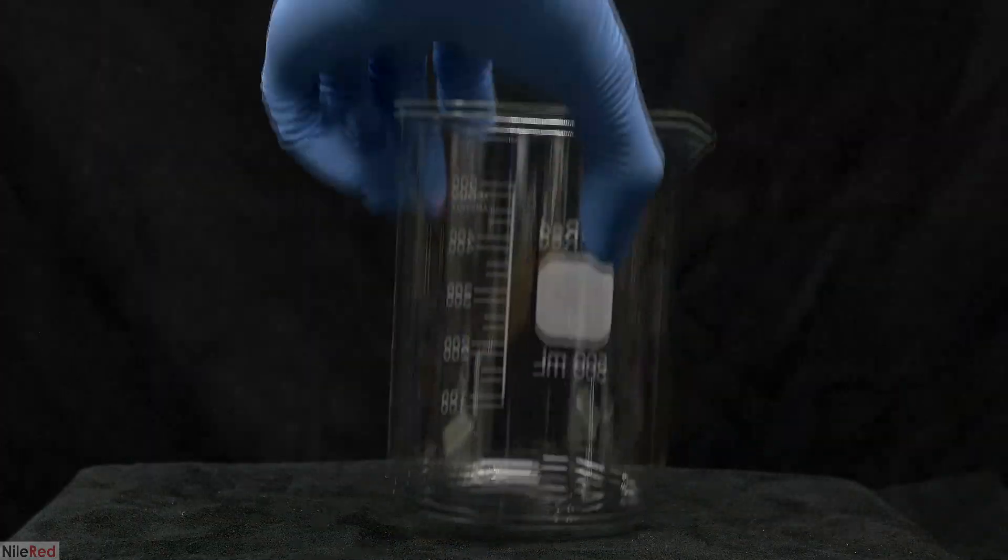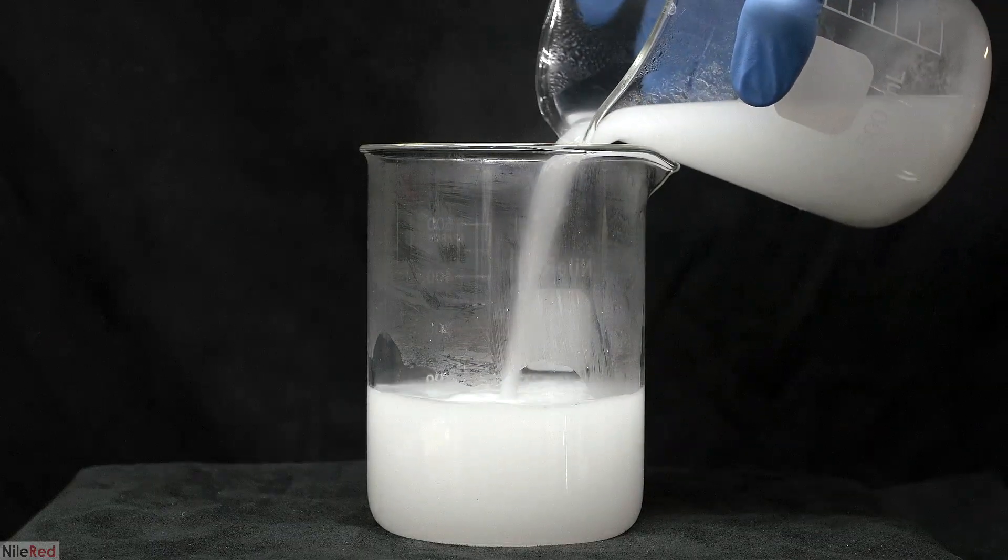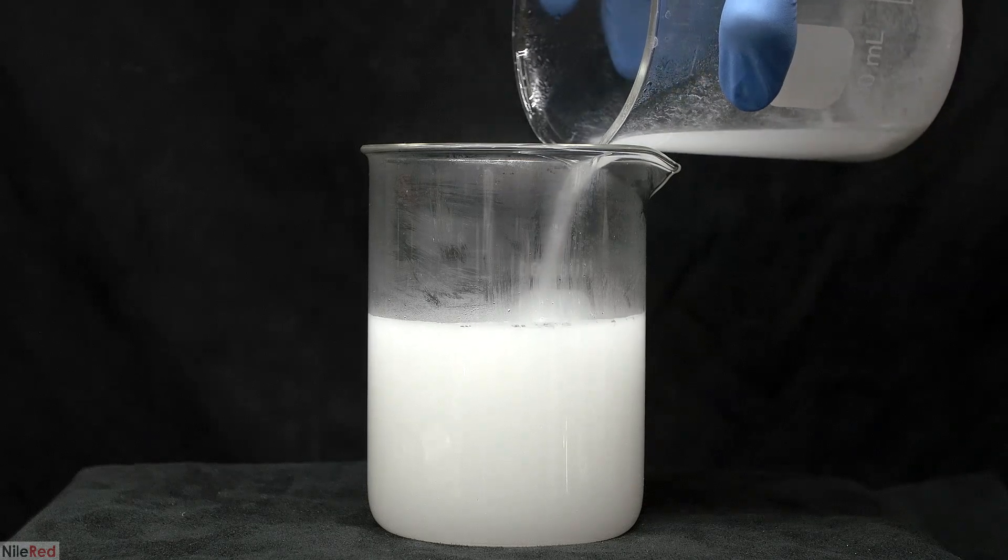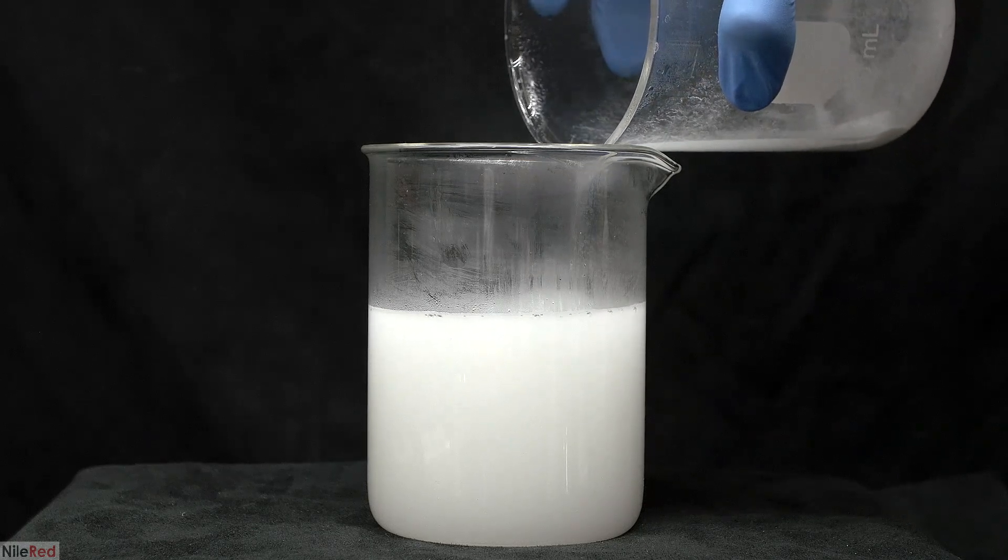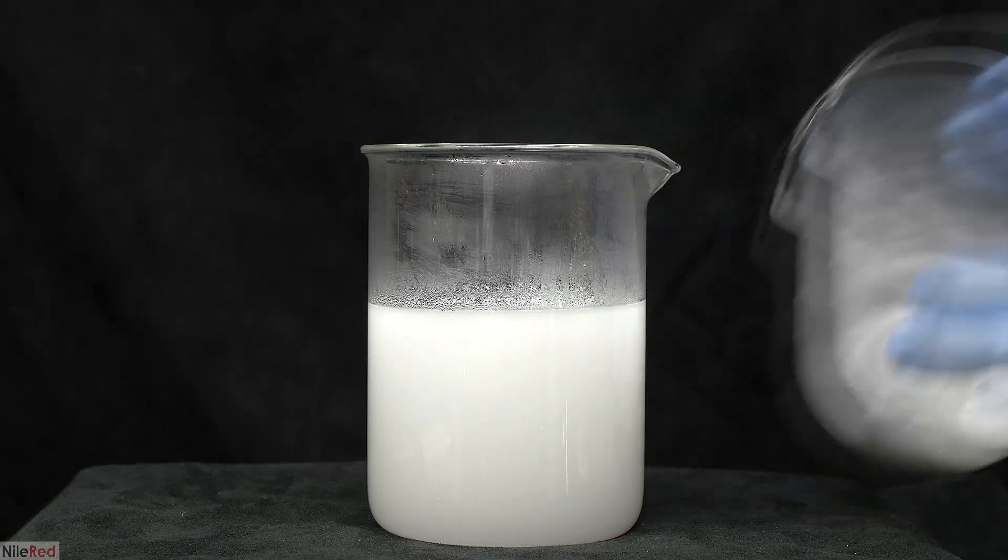This is the only thing that seemed to work decently. The solution was reboiled, and I let it stand for the solid to sink to the bottom. I then poured off the liquid, and I left behind the solid stuff. Unfortunately, I don't think it's very easy to clean up further, so I just let it crystallize.